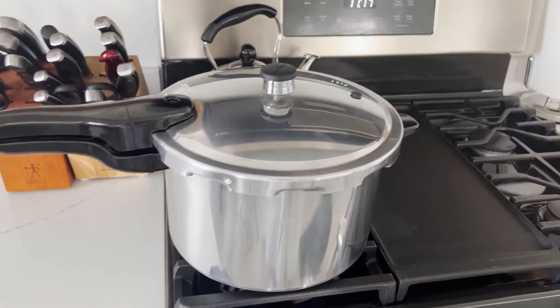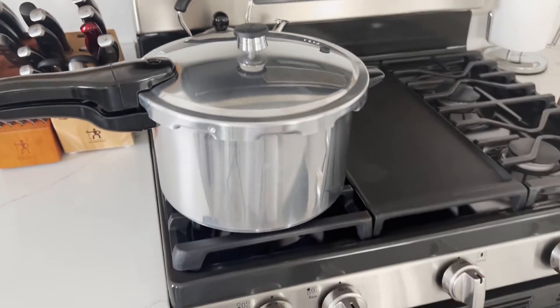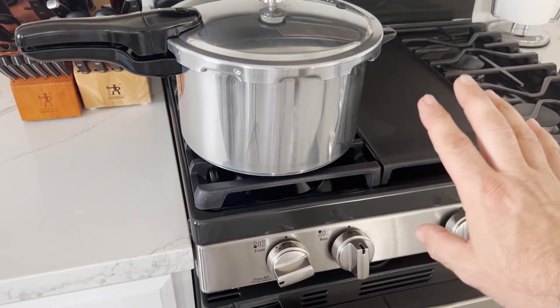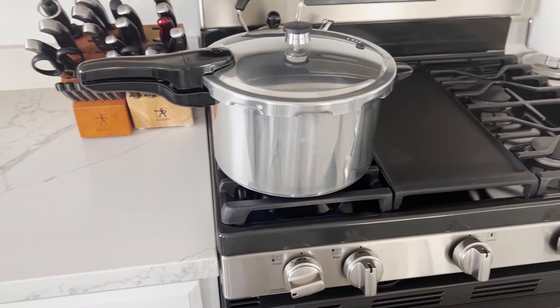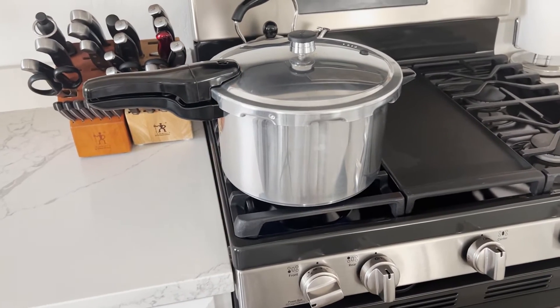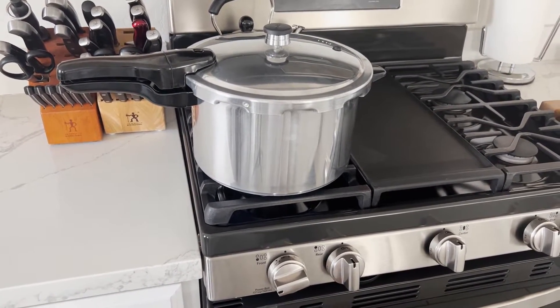After 15 minutes, we're going to put our 15-pound rocker on there. Leave the heat on until it comes up to pressure. As soon as this rocker starts to wiggle back and forth, we're going to turn the heat down just to stabilize the pressure inside — we just want to maintain it, not build more pressure. We're looking for 15 PSI.